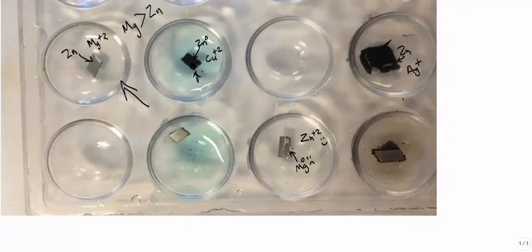And the confirmation is here as well. Do you see the discoloration right here? And the fuzziness right there? And the discoloration, it's almost like it's rusting. What you're seeing growing on the magnesium metal is zinc 0. Why? Because the magnesium is able to give zinc its 2 electrons, and the magnesium is now dissolving into the solution.